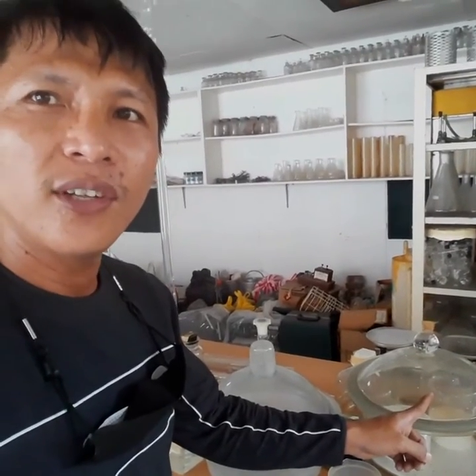Okay, so this is a desiccator and then you have a desiccant. Maybe I'll just be adding the desiccant to your repertoire of laboratory tools and equipment. Okay, this is video number, I don't know how many videos I made.